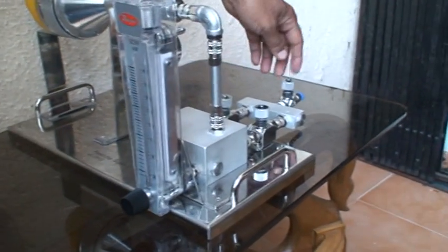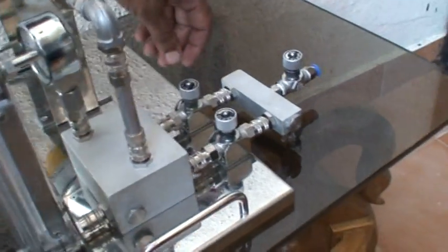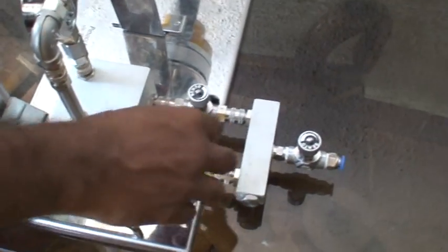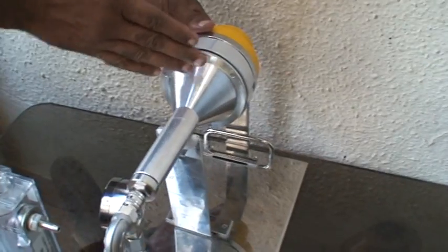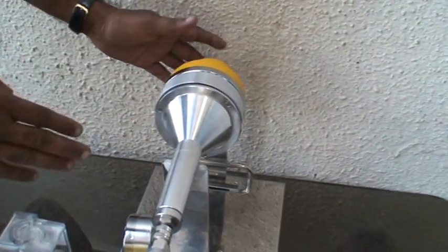Once you set the flow from this rotameter, simultaneously switch off this valve and switch on this one. What happens is the air that was coming through this path, since this valve is now off, will come through here, pass through here and through the unit, and the compressed air will fall directly onto the petri dish. Whatever microbes are present will fall onto the petri dish and the air will exit from here.